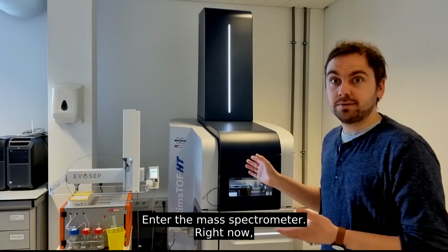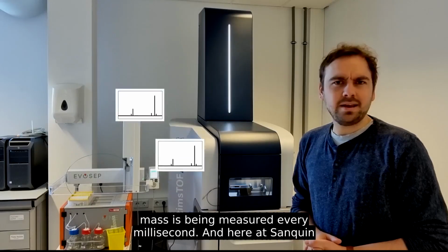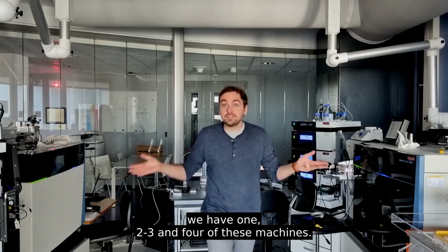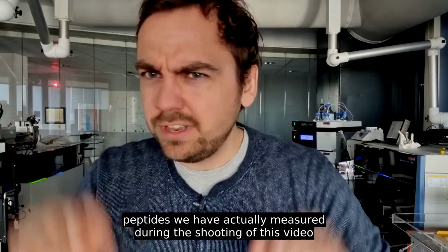Enter the mass spectrometer. Right now, thousands of peptides are flying through this machine and their mass is being measured every millisecond. And here at Sanquin we have 1, 2, 3 and 4 of these machines. They run 24/7, so you can imagine how many peptides we have actually measured during the shooting of this video.